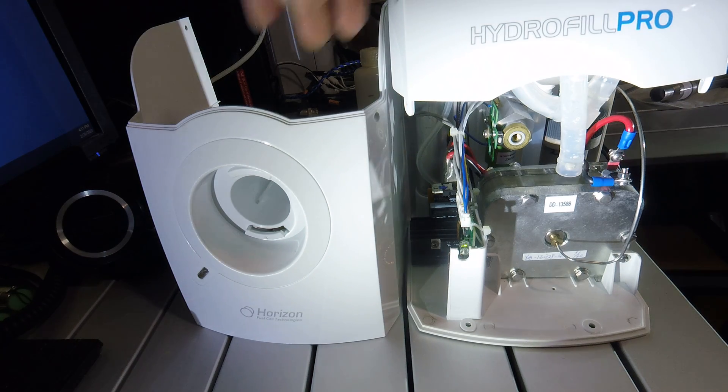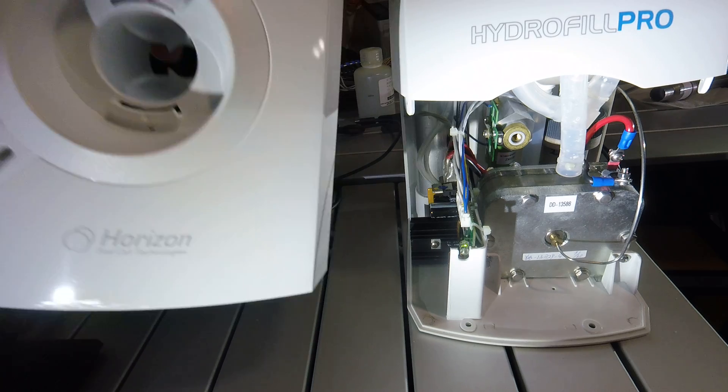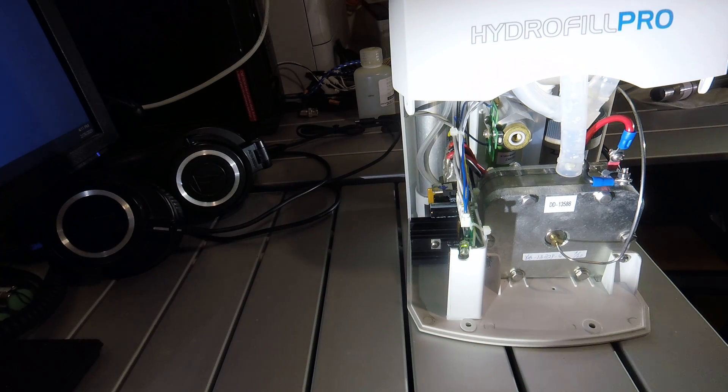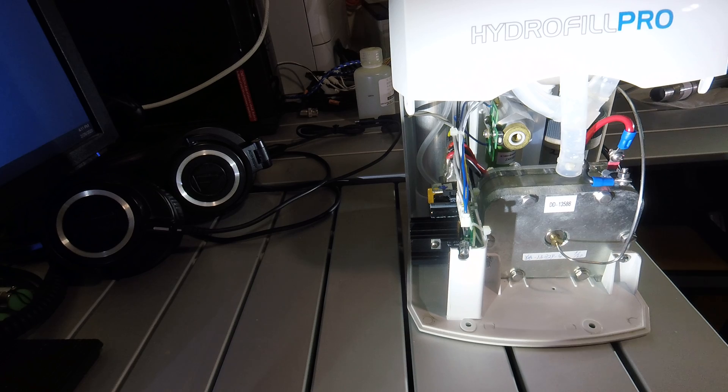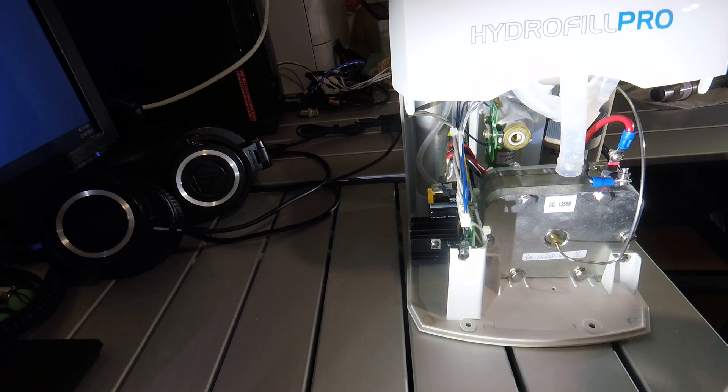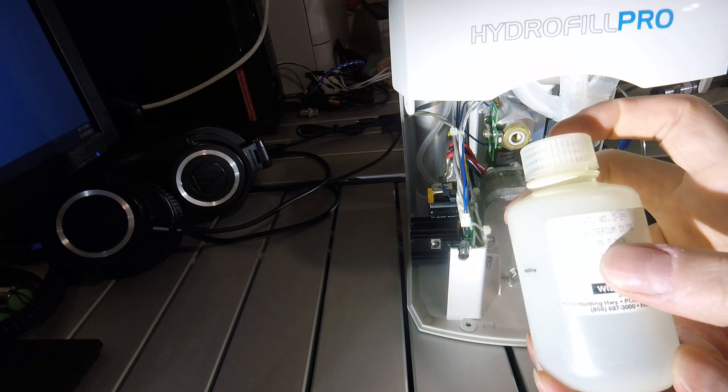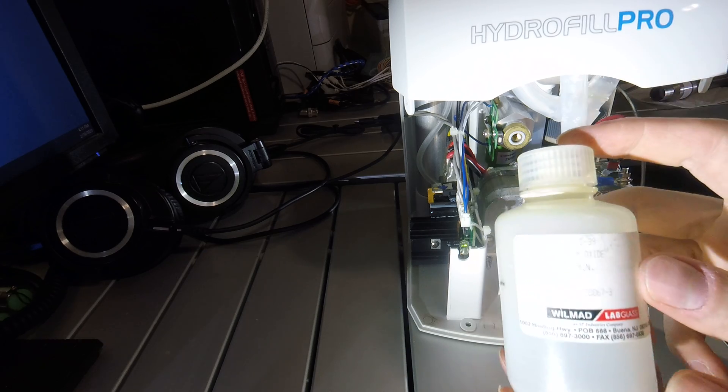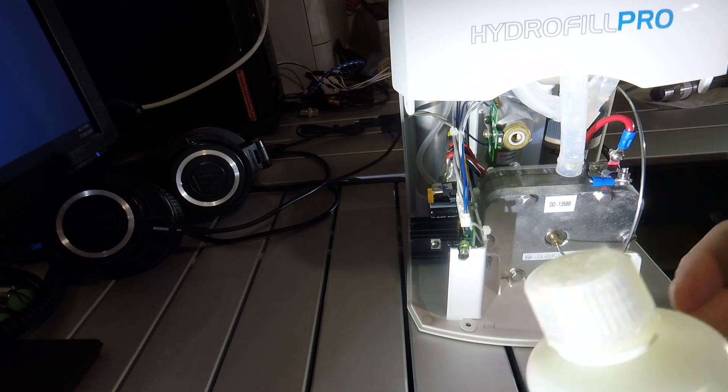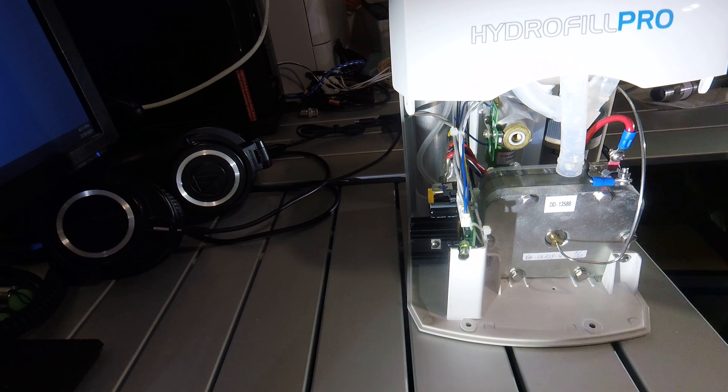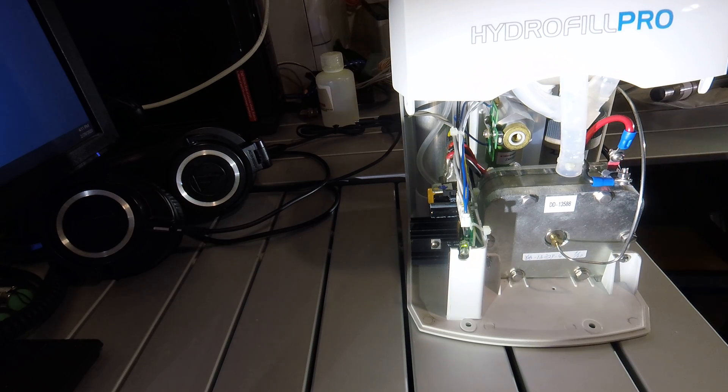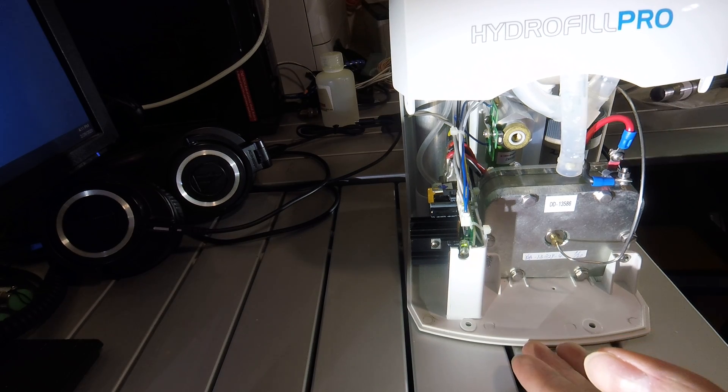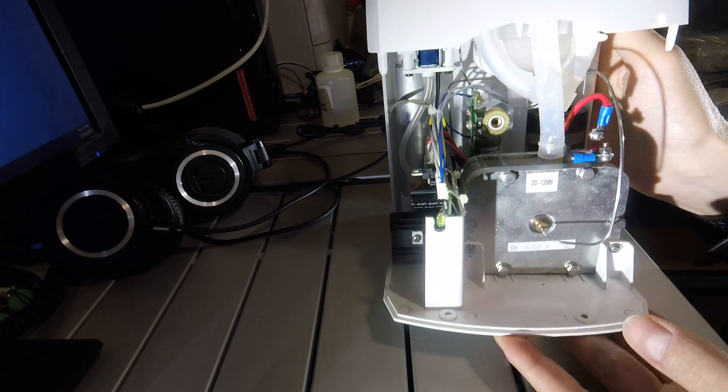In this case, I've removed the front cover from the generator. And instead of using common distilled water, I am using 99% deuterium oxide or heavy water. And when electrolyzed, instead of generating hydrogen, this will generate deuterium. So let's have a look at what's inside this hydrogen generator.